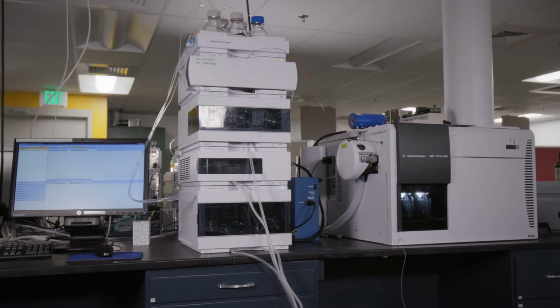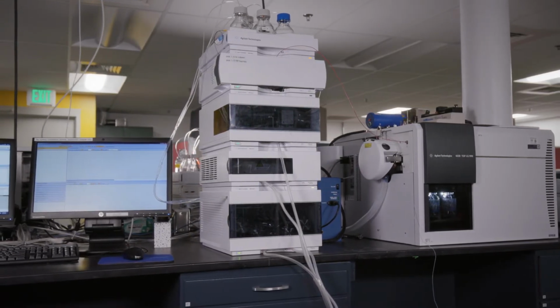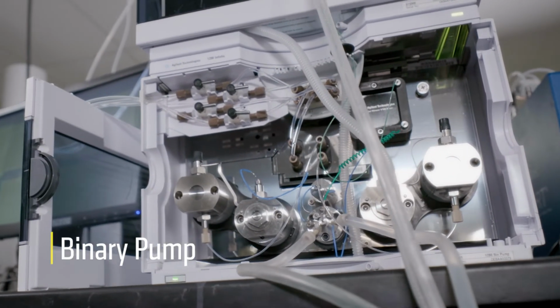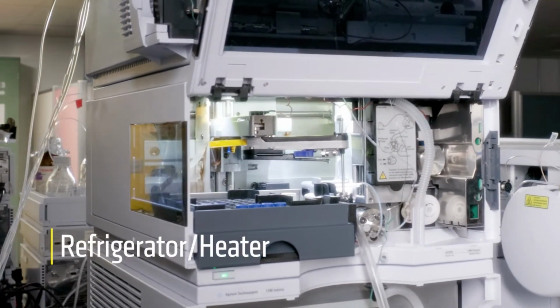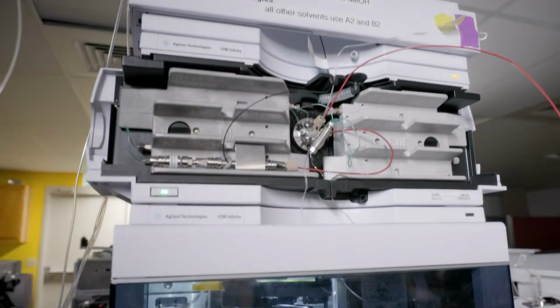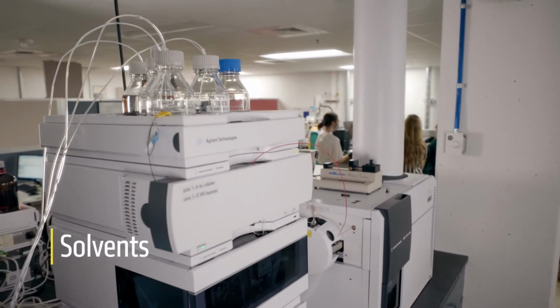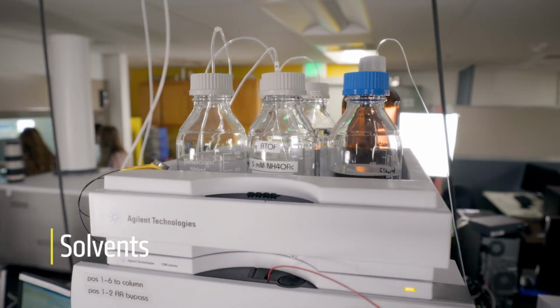Generally, this system consists of three major components. First is the Ultra-High Performance Liquid Chromatography System, or UPLC, which contains a binary pump system, a thermostated sample compartment, an autosampler, and a chromatography column compartment. The binary pump can draw from two different solvent bottles simultaneously. These bottles sit on top of the instrument.